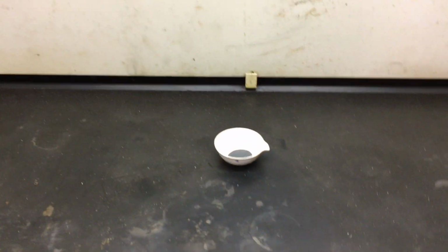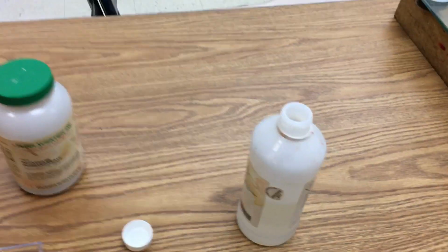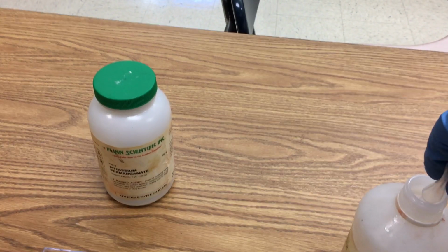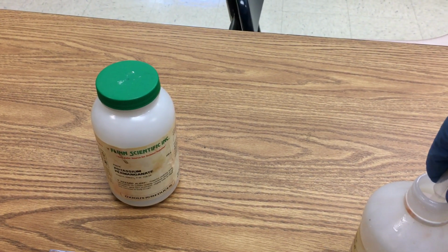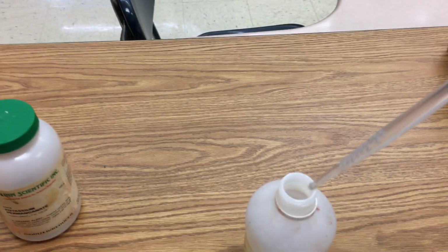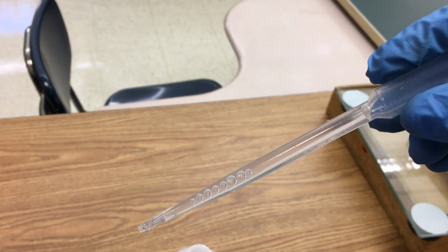Now the reaction might take a little bit to get going, so I want to start the reaction and then we'll come back and revisit the properties of the reactants, so you have more time to fill those in. But I just want to get this going for the sake of the video. We also might fast forward through it, but let me try to focus it a little bit.